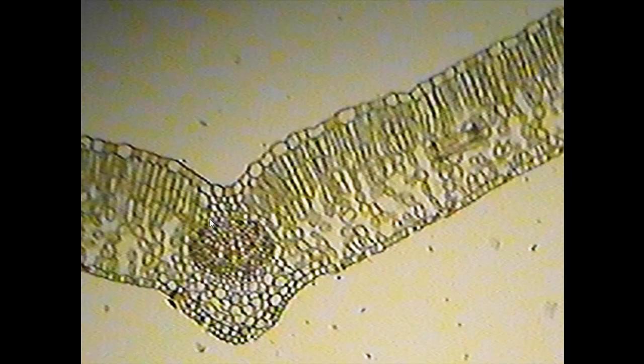If there is a little bit of a neck at the top here, around sort of connecting the circle, which is the vascular bundle or the vein, to the top, that's probably collenchyma. And down the bottom here, especially if you see cells that have quite a dark outline, and just under the epidermis here, these ones at the bottom look to me like they might be slightly darker around the edges, so maybe we've got a bit of collenchyma there too. So that's really those tissues. I hope that makes things a little bit clearer.